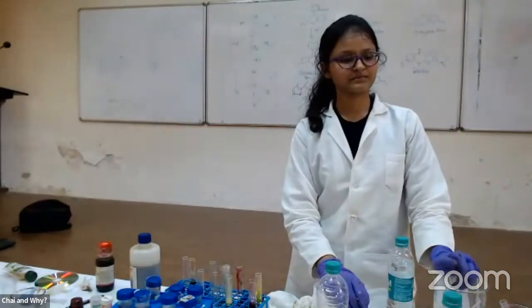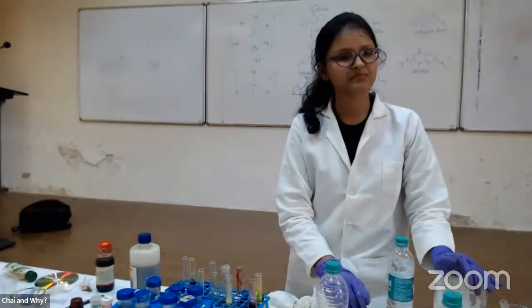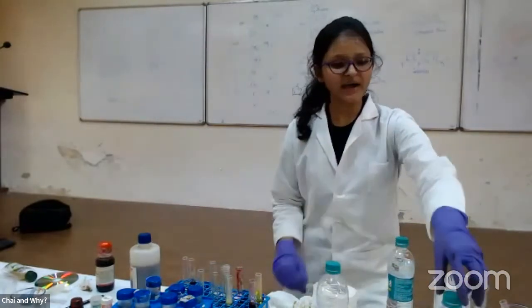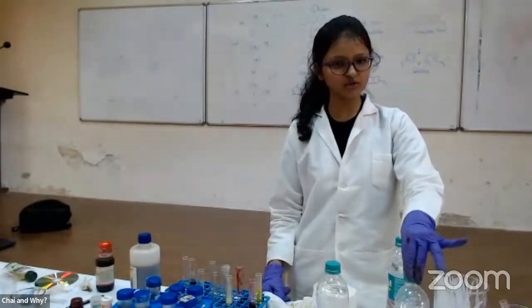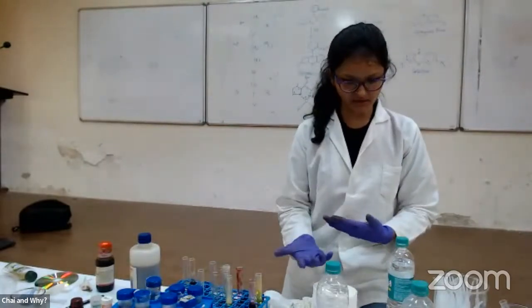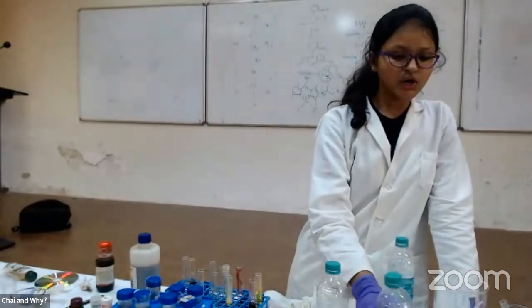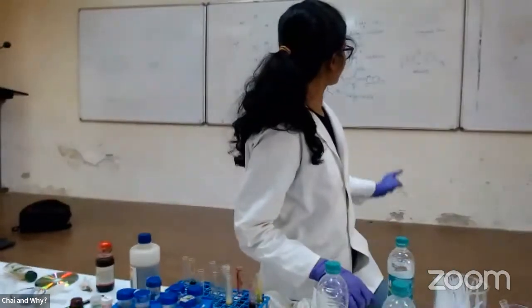Okay, and there are a couple of questions asking, can you please explain what happened in the blue bottle? What did you add? Why did the color become transparent? Can you go through the methylene blue chemistry again? Sure. I have added glucose, which is known as a reducing sugar, and to make it act like a reducing agent, I added sodium hydroxide. Now methylene blue is being changed to a form which is colorless. Here you can see the reaction.